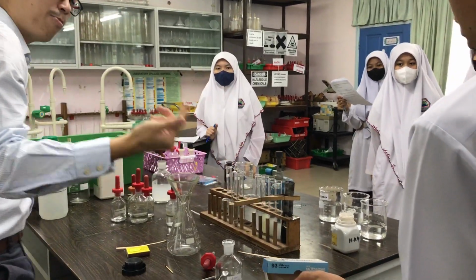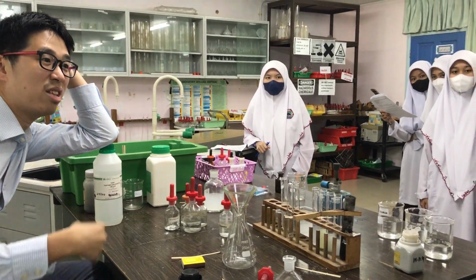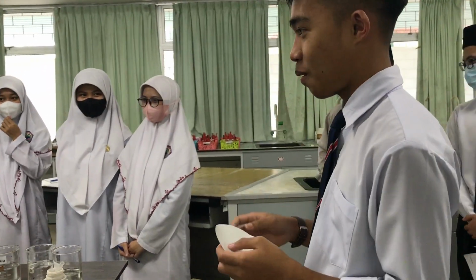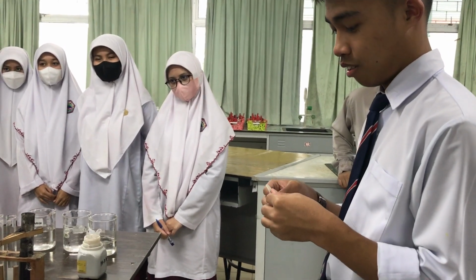Okay, show me how to prepare the filter paper. How do you prepare filter paper for filtration? What do you need to do? Tell the camera, what are you doing? Fold. How do you fold it? Fold it into half, okay? And then?